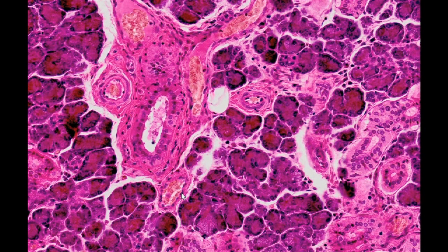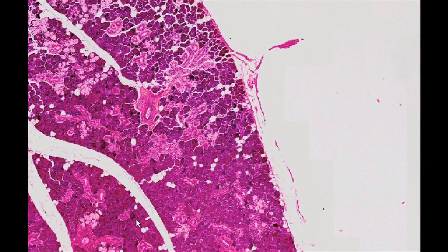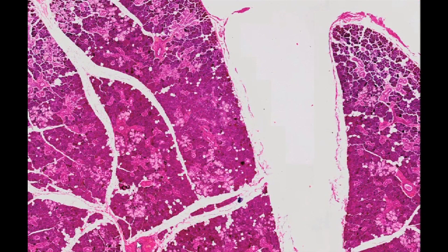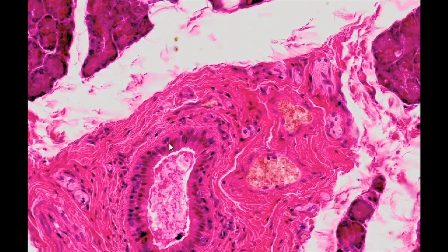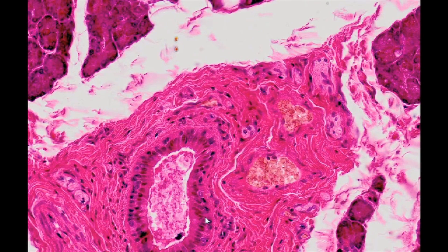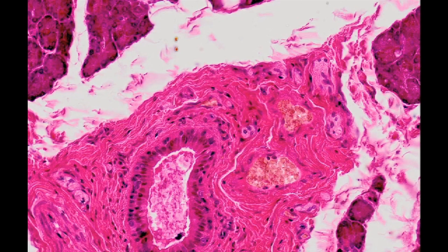In the main duct, Wharton's duct, a two-layer columnar epithelium is seen, which passes into stratified squamous epithelium at the bottom of the oral cavity, on the sublingual caruncle.